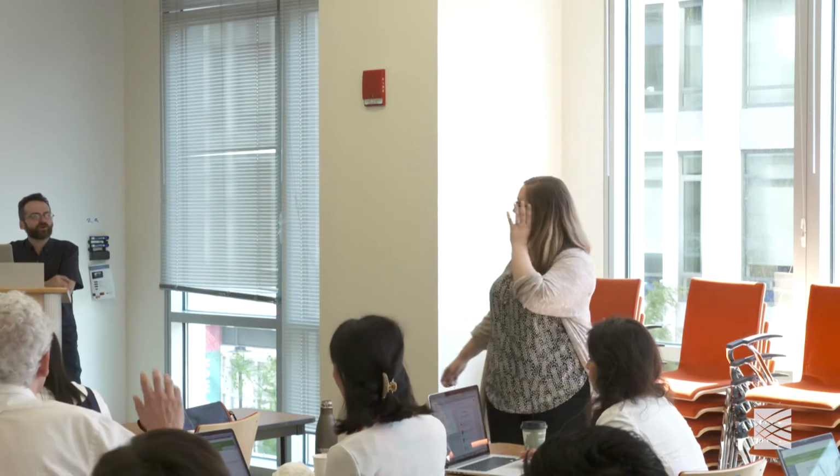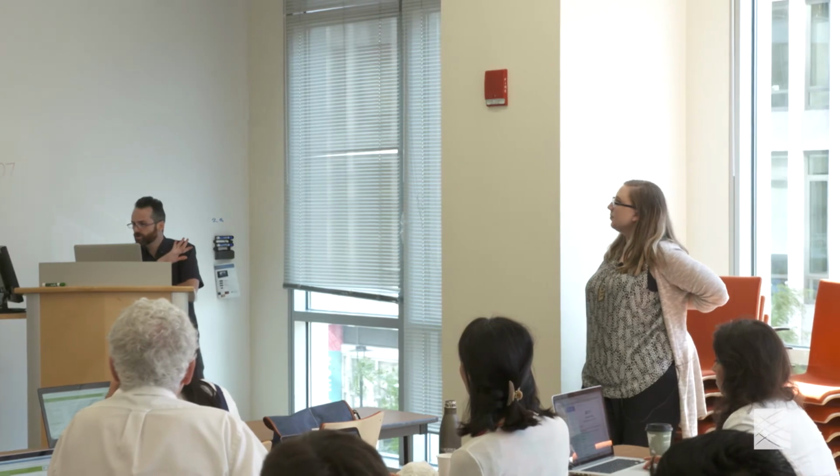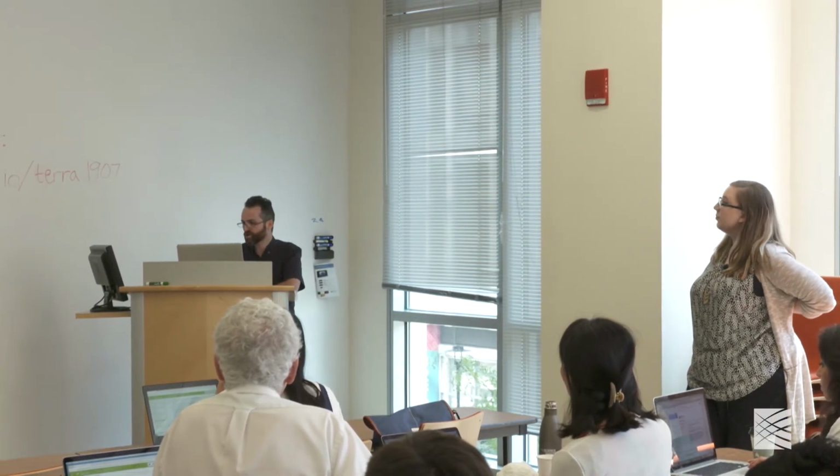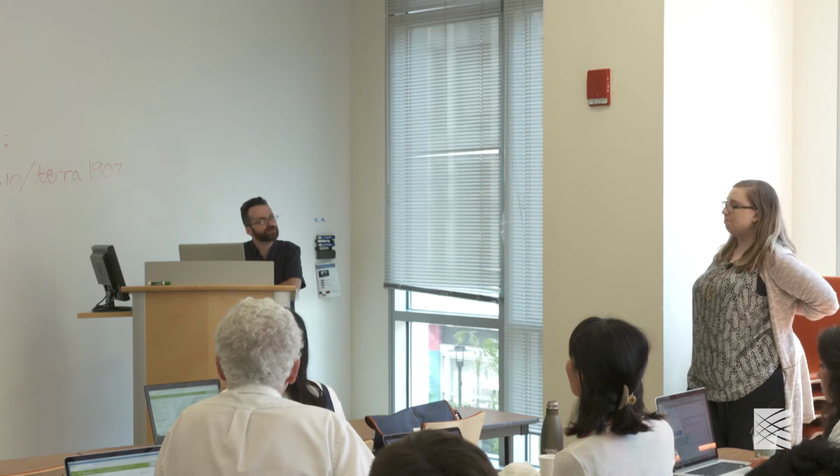You can move all of your outputs to your Google bucket. Yes, like Tiffany's saying, you can move all file outputs from your notebook to a Google bucket so you can save them permanently, and that way they won't be deleted. If I recall, the cost estimate for just having your idle, paused notebook was something like $20 a month, I think it came out to.